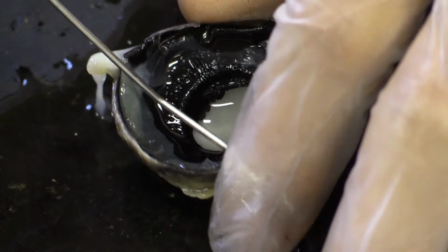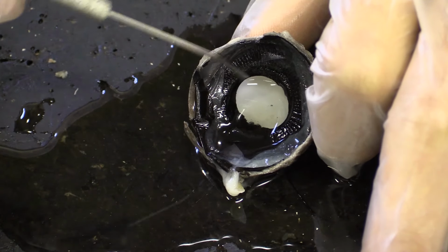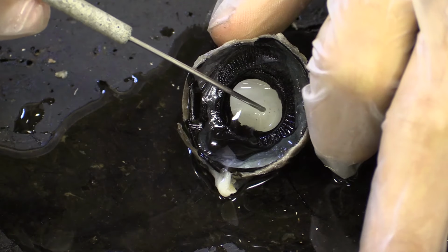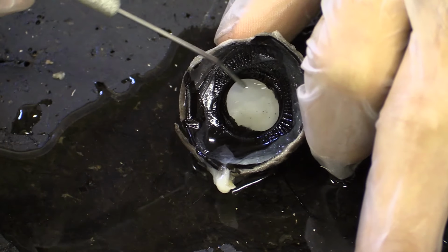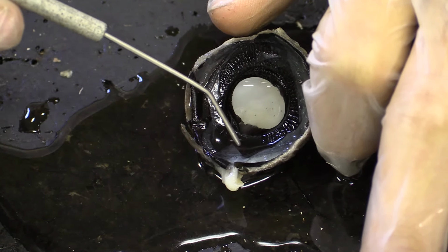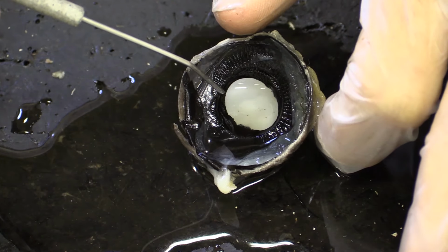And this controls the aperture, the size of this hole within the eye. This hole here is called the pupil, and it is effectively the aperture. The aperture of a camera is how big the hole is that allows light in. The aperture here that allows light into the eye is called the pupil. And here we have the iris. The iris is the body that controls the size of the pupil. So during the day, the size of the pupil will decrease because there's a lot of light, and during the night, the size of the pupil will increase to allow more light in because there's of course a deficiency of it.